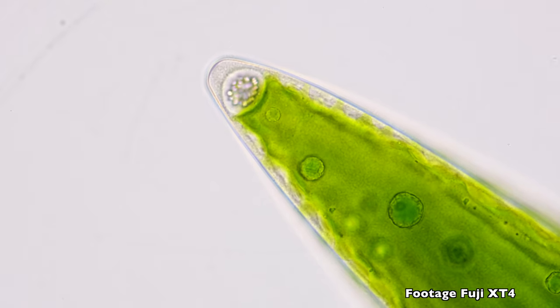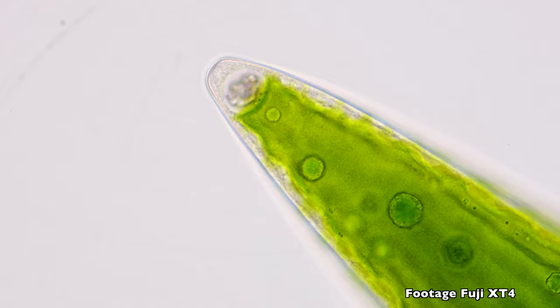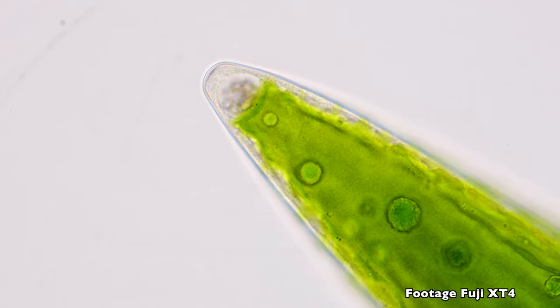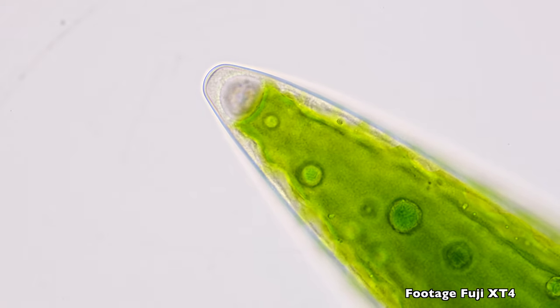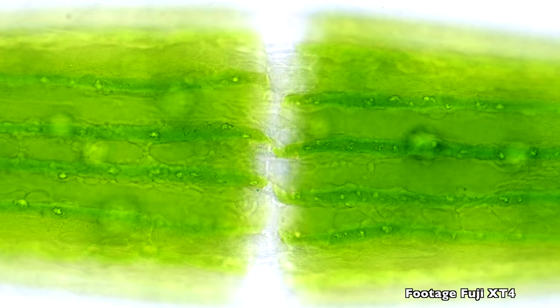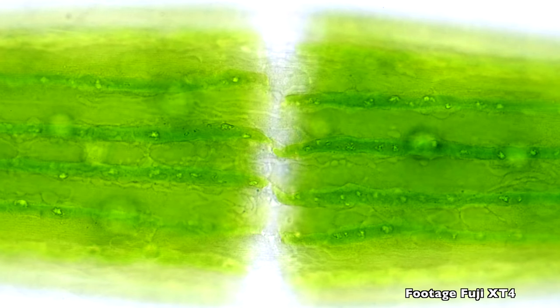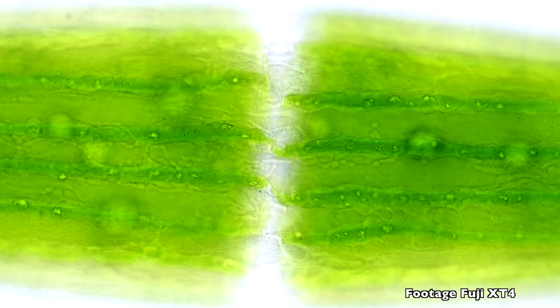So the footage you're seeing in the background has been taken with the Fuji XT4. And as you can see, it produces really very pleasant colors. The footage you're seeing, by the way, has not been altered in any way. It is straight out of the camera. And I think the camera does a very decent job. The level of detail is right, and, well, the white balance is really perfect.